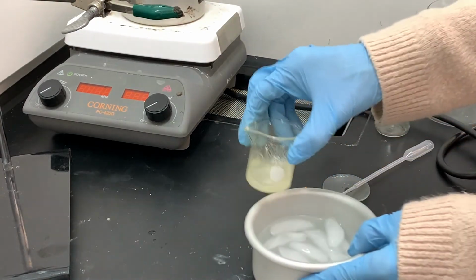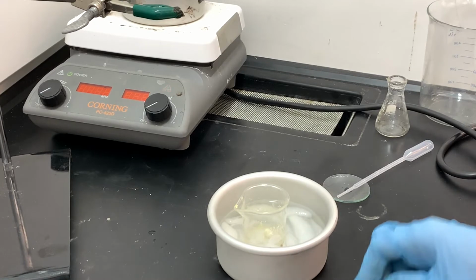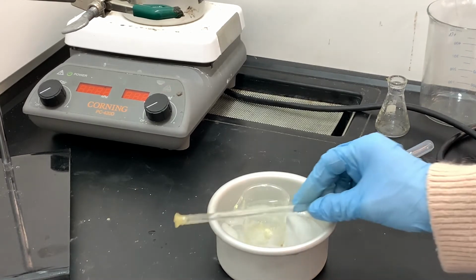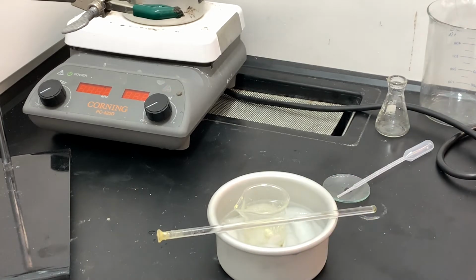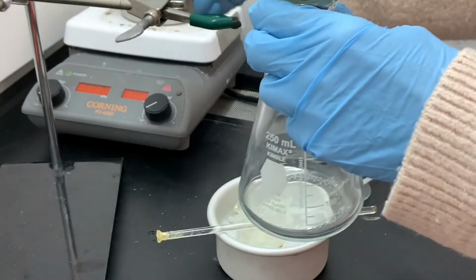So the next thing that I'm going to be doing is filtering the crude product. This is going to be really different from normal filtration or recrystallization techniques, mostly because the majority, maybe even all, of the product of this reaction is stuck to that glass stirring rod and also stuck to the inside of the beaker. There isn't very much product to begin with, and there's a very small amount of that product that's actually suspended in the liquid.